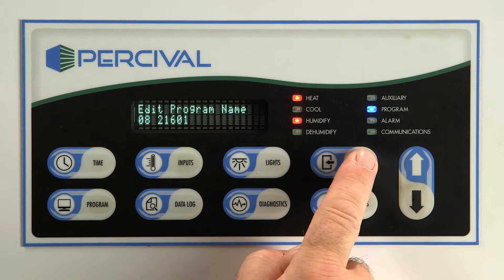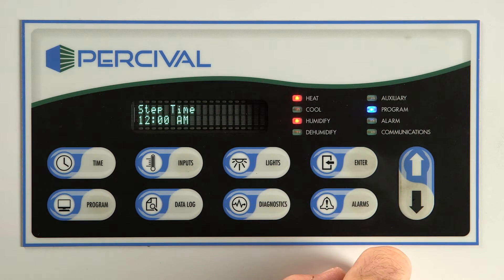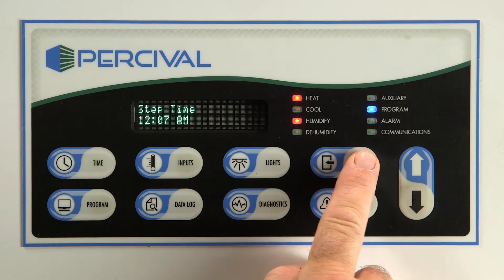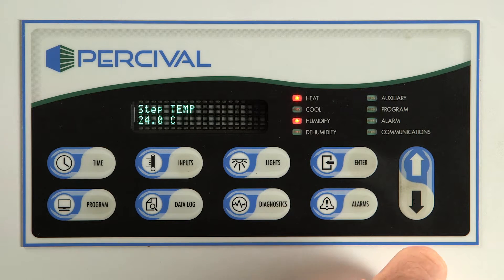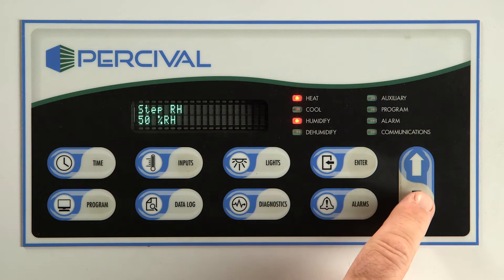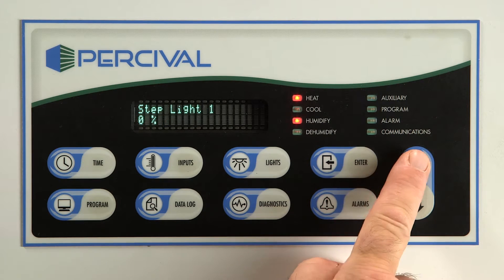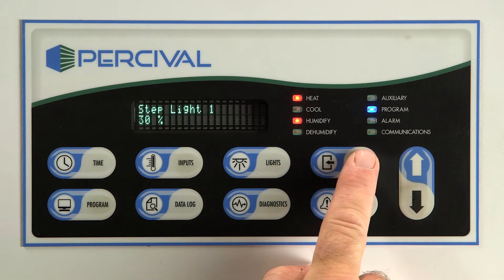Add step will be flashing. Press enter. Using the arrow keys, set the start time for the first step. Press enter. The next few settings are similar to the settings for diurnal mode, but also allow changing of the light events or, if equipped with dimmable lighting, the light intensity. Once all settings have been entered, they will be displayed.